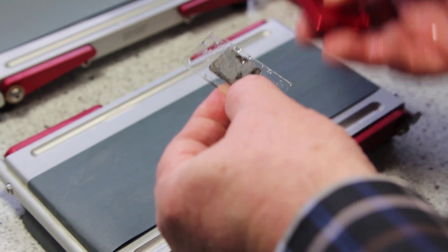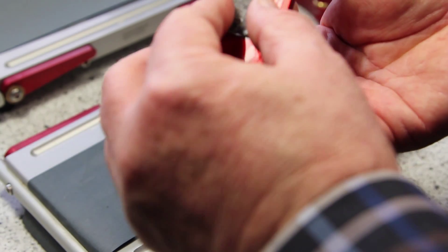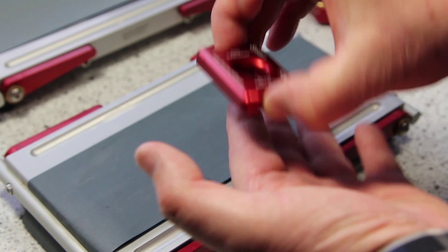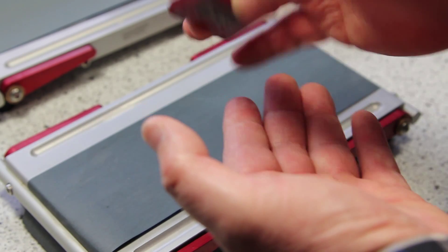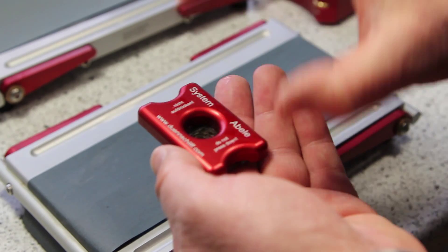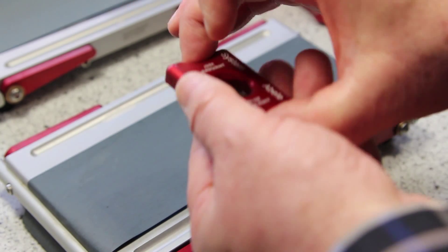I use now the polishing mount. I put it in here with this base. I can hold it very good.